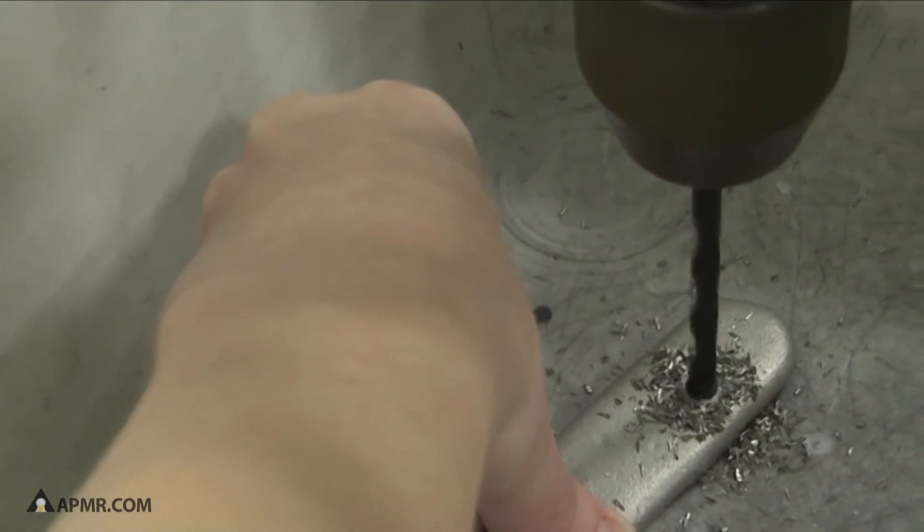We're going to take two samples — one from the top, one from the bottom. We have to make sure that this pan is clean between each sample that's drawn, so that we don't get any cross-contamination between the top and bottom of the bar, and from bar to bar between samples.